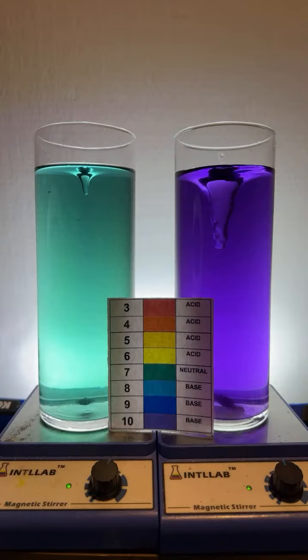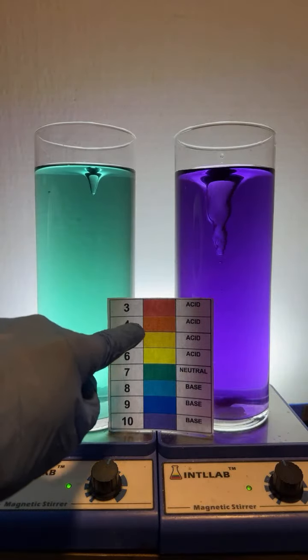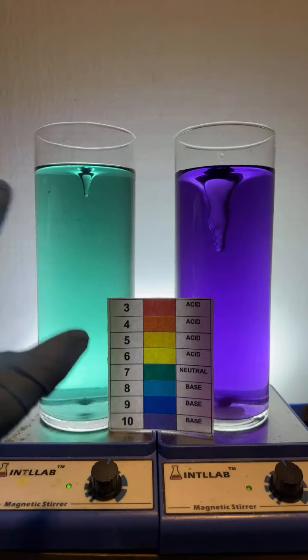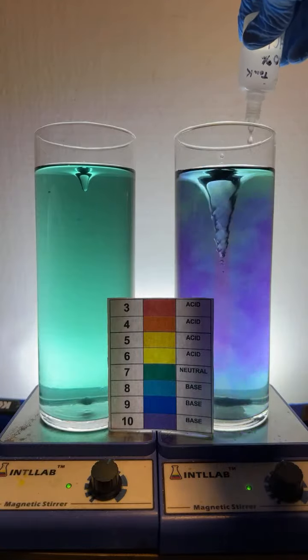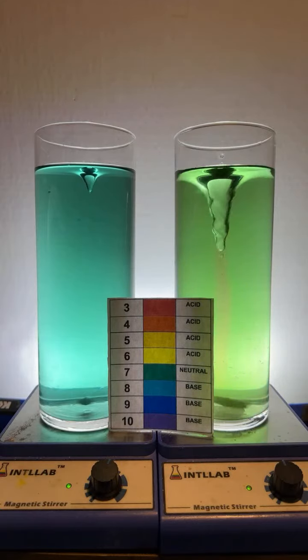I just saved these. So once I'm done, I have learned that I need to make the pH somewhat acidic. If the pH is somewhat acidic, I can just leave it here on the shelf and come back to it later. If I make it basic, then mold tends to grow in the solution, so I don't do that.